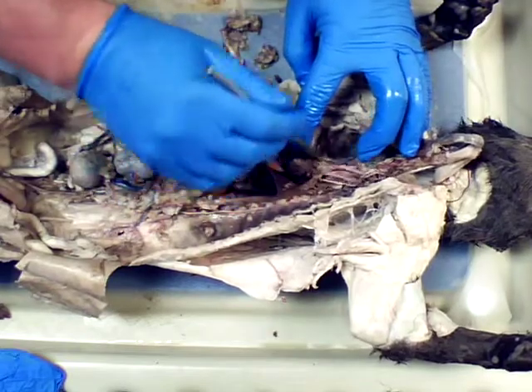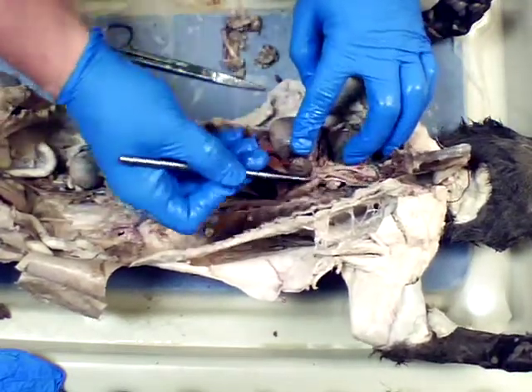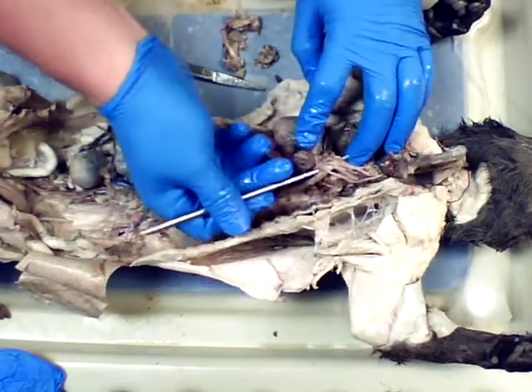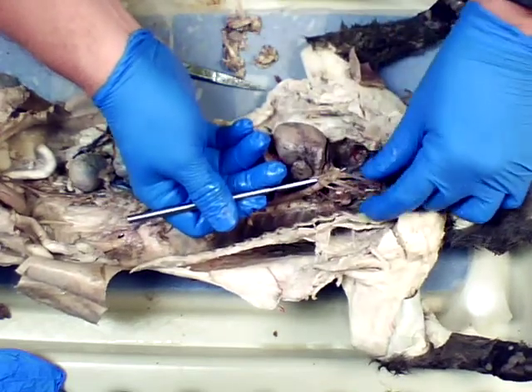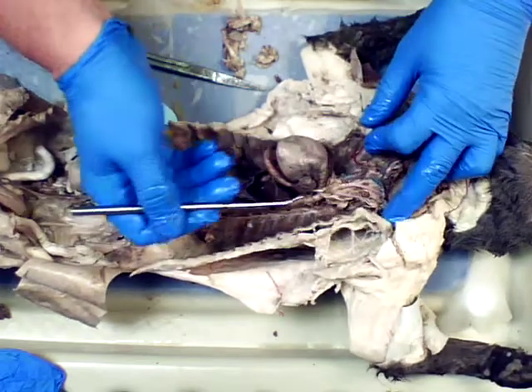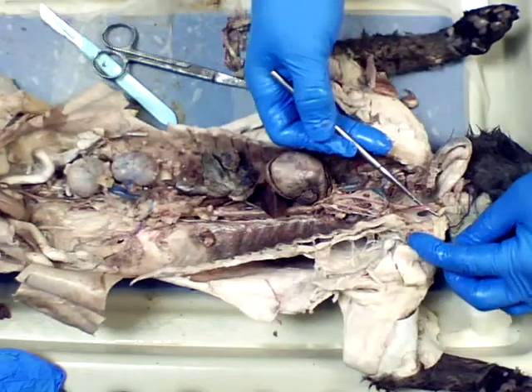I can't get all this connective tissue out of the way, but descending aorta, and then there are your portions of the aortic arch that are going to go up into the head and then start to divide and be what would be the brachial portion. So again, as we just follow it, there's going into the arm. Here is blood going up into the head.